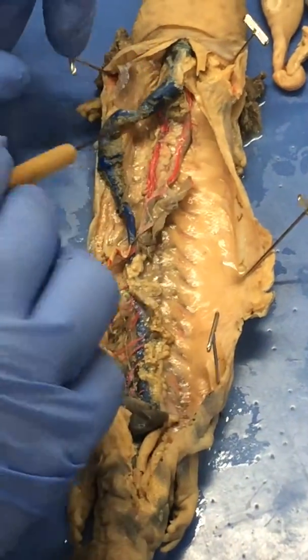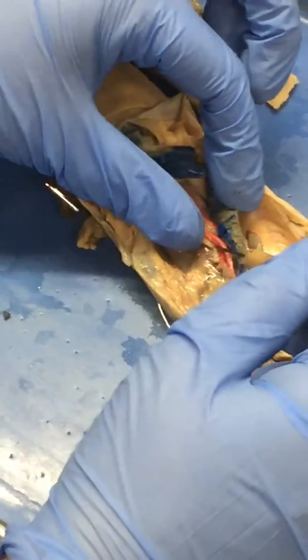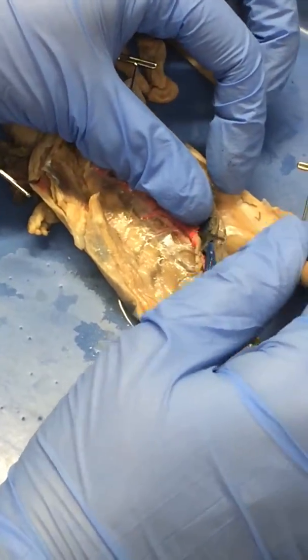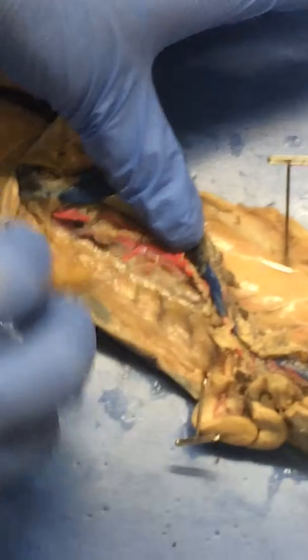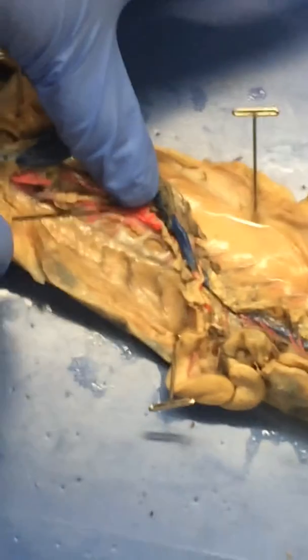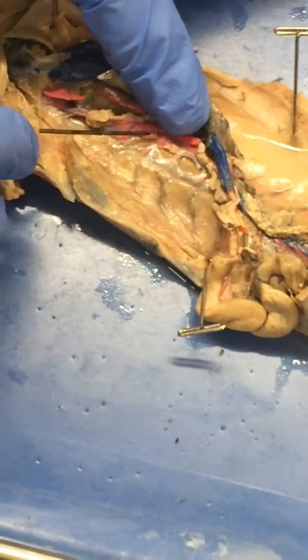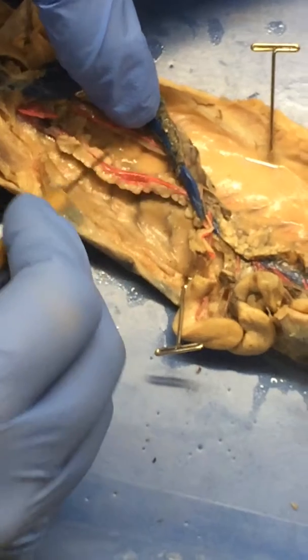Way under here, and it was very hard to see. You see the vein here — it's really, really faint and hard to see. But that is your posterior cardinal vein. It's a very small vein underneath the dorsal aorta, which is here.